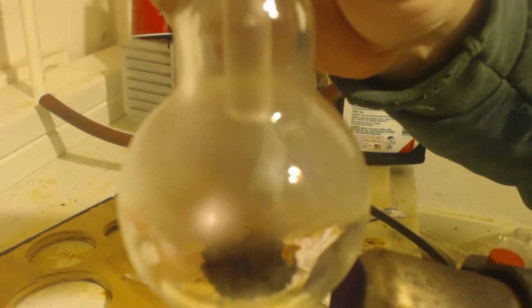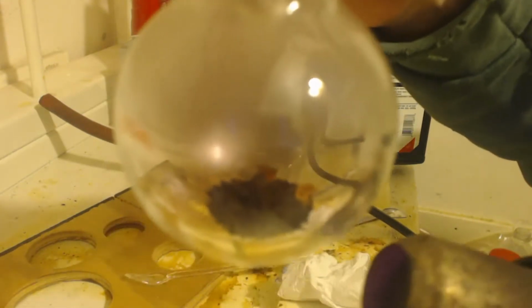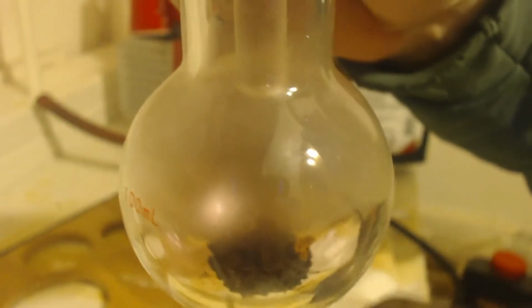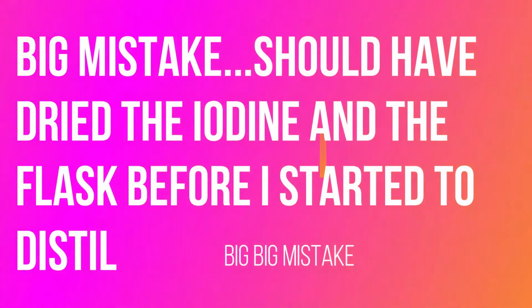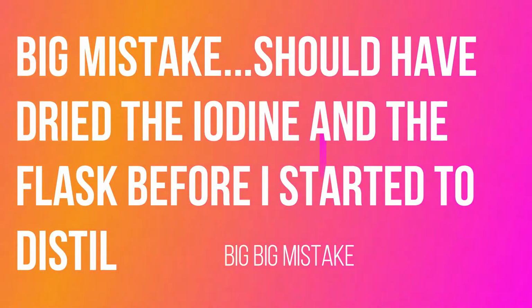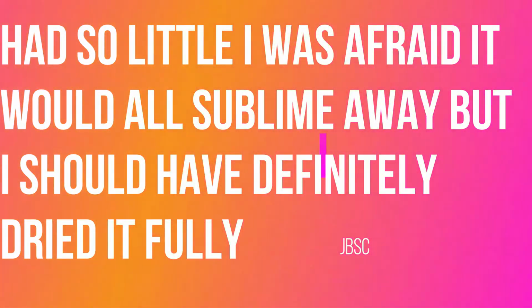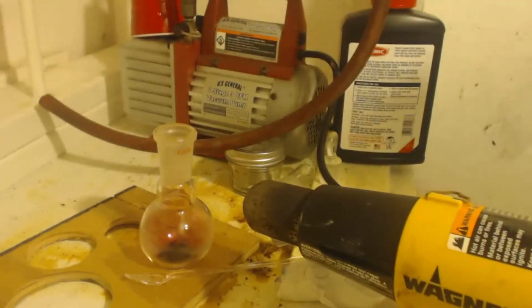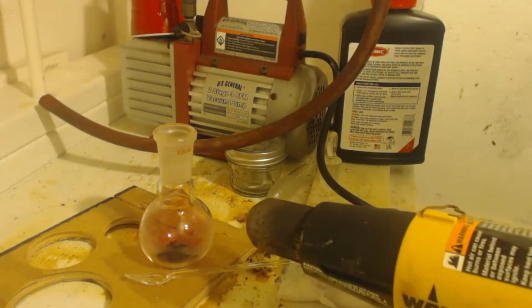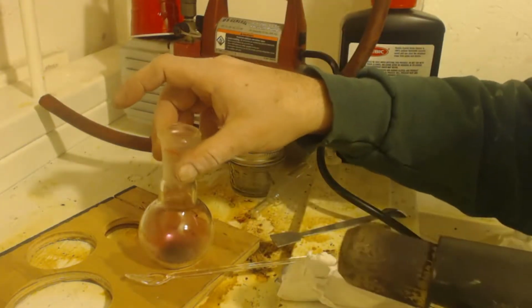See that cloud of water? I should have got all that water out of there first. Now it's going to interfere. Should have heated this up and got all that water out. Oh well. Trying to get that water out of there, that condensation. Alright, here it goes.